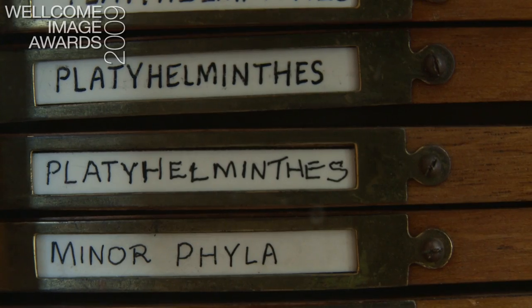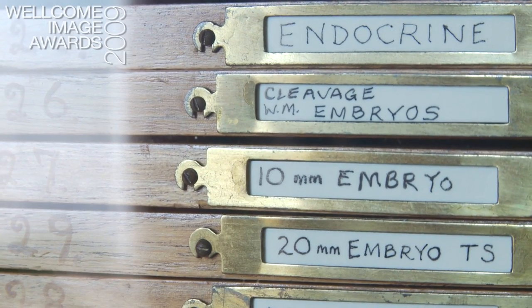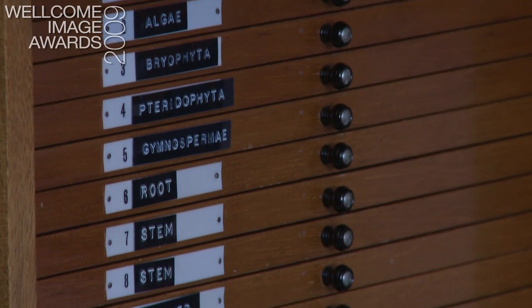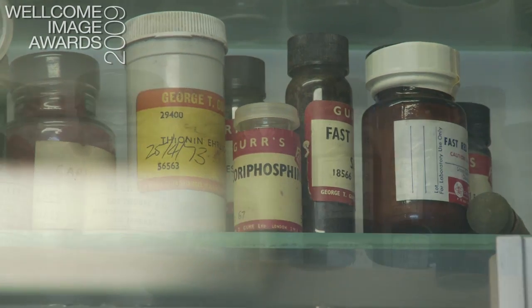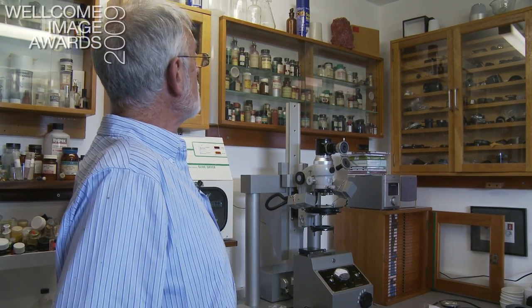Specimen preparation is of great importance to the final result. Most biological material is too thick to get the best results; sections at one micrometer or 1.5 micrometers — what are called semi-thins — reveal far more detail. If you can't cut sections, there are other ways of preparing a thin object. For instance, in the case of blood, you wouldn't have it in a test tube — you would smear it out into a very, very thin layer on the slide and then stain it. These are just some of the stains that it's possible to use.